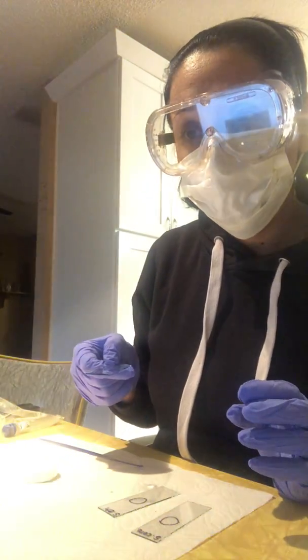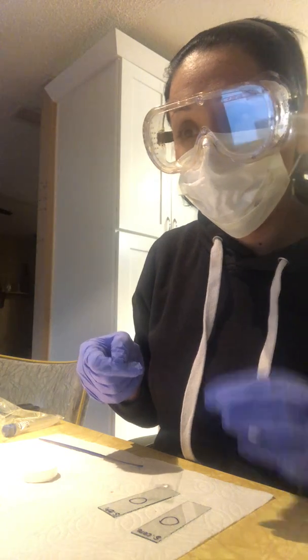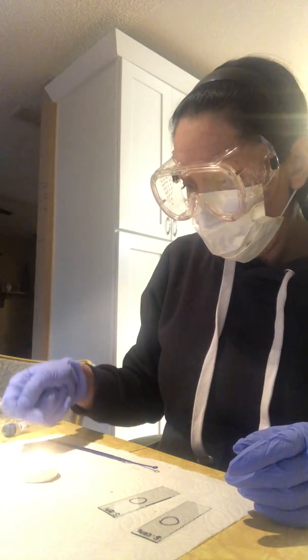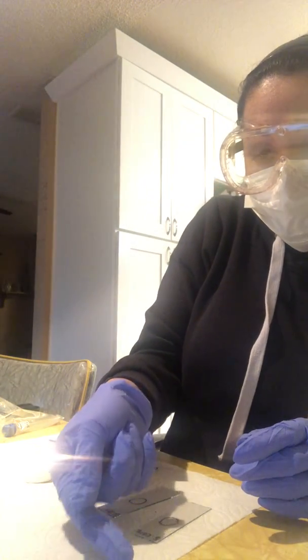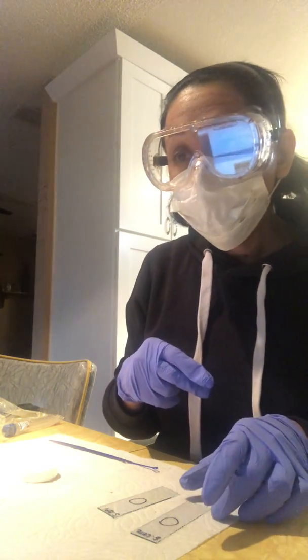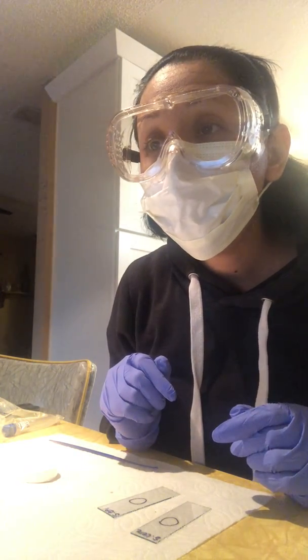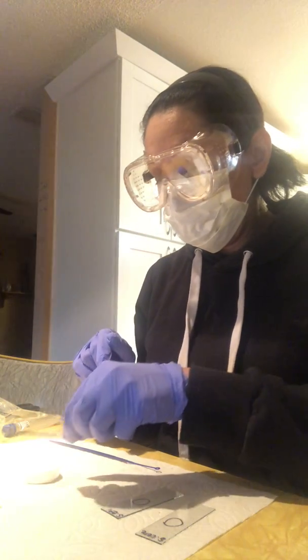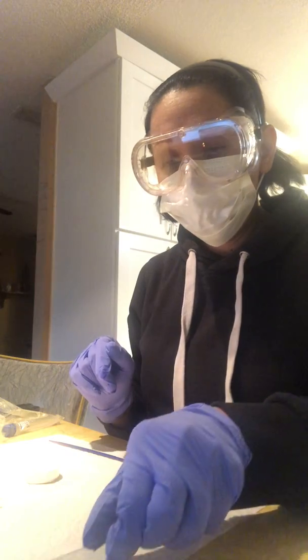That's good to know. Repeat, and allow it to cool. Okay, so here we go. Well, actually, I only did it 3 times, I think. There we go. Total of 5 times.